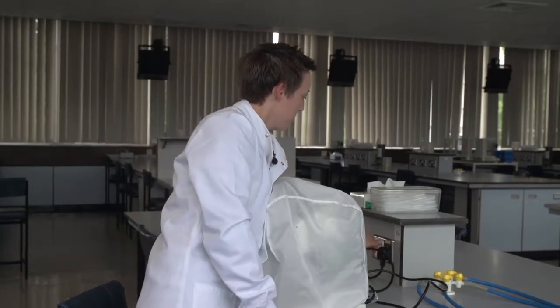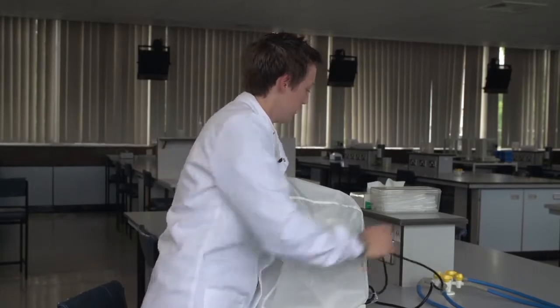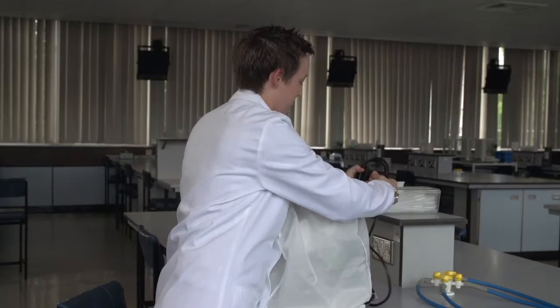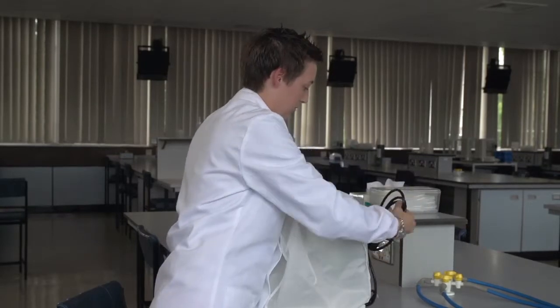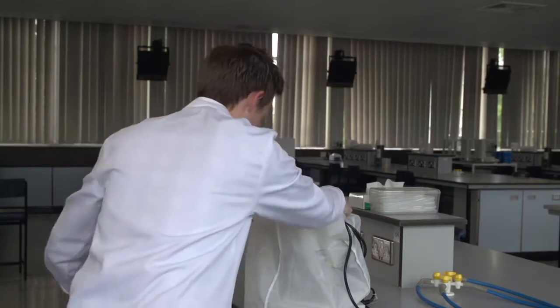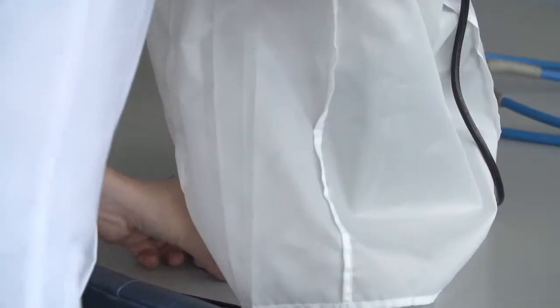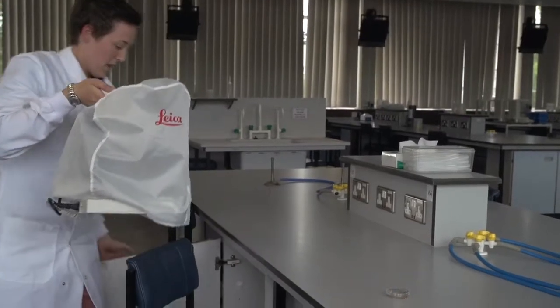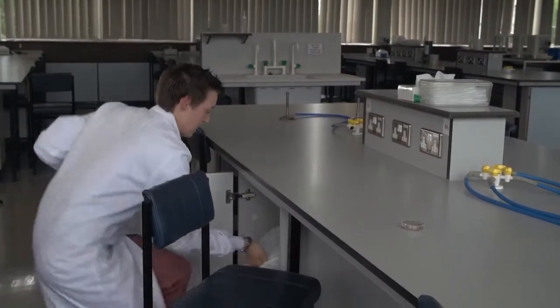We can unplug. And using the handle again, carefully lift the microscope and replace the microscope into the cupboard.